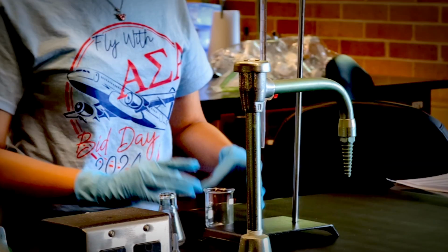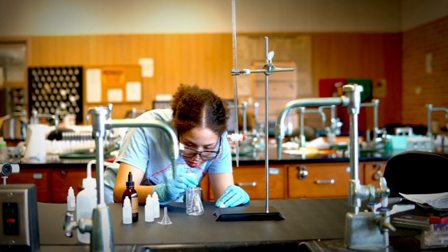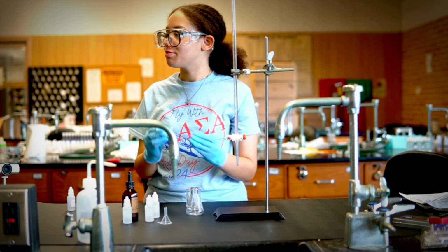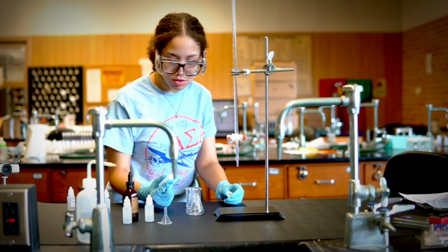And at the bottom of your burette, you're going to have your flask and your beaker. To get started, as discussed in the introduction, we are going to titrate our known concentration of base into an unknown concentration of acid. That will inform you where we add the acid and where we add the base. If we are titrating something, we're going to put it in the burette. If we are titrating to something, we're going to add it into the beaker or the flask.